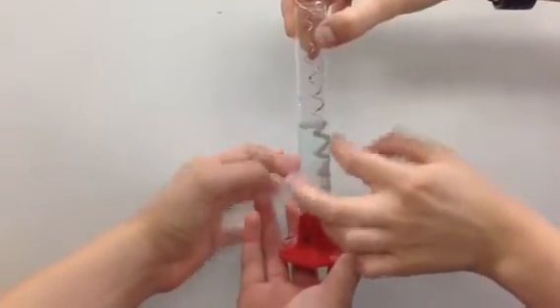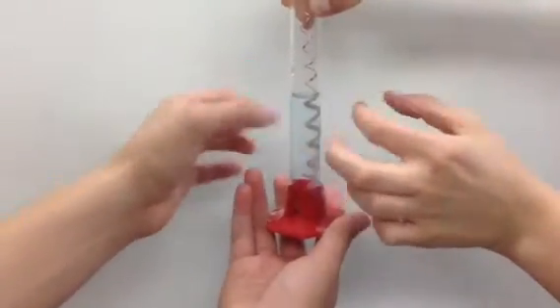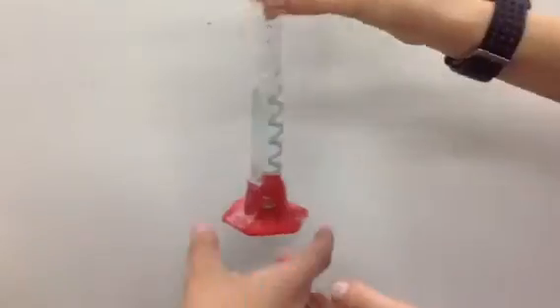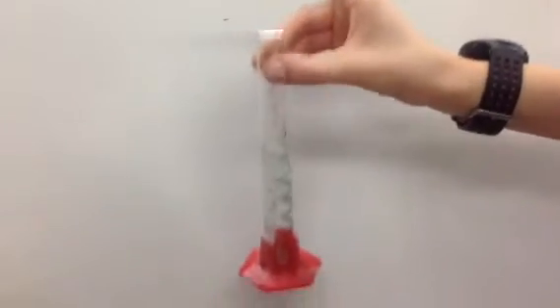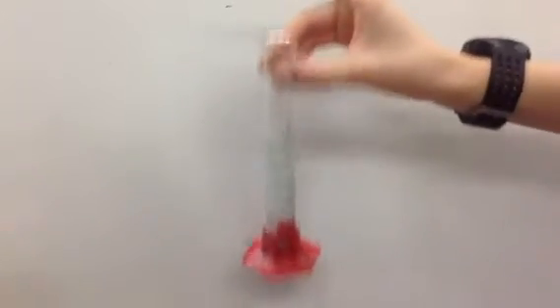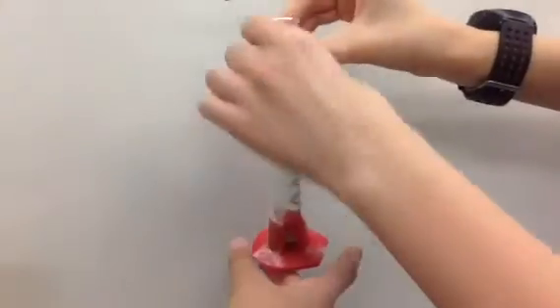Oh my god, it looks like it's snowing! You guys, this is so cool! Snow globe. Woohoo. Okay. Don't get it to splash because this stuff is very, very bad. It's not that bad. Yeah, it is. Okay, there we go. Alright, now hold it still.